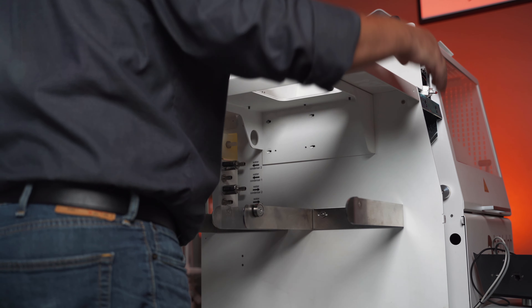The final panel is going to be that top piece. Remember to reinstall your emergency stop — that just clicks into place. Line your pins up here with these two holes, and the post from the locking mechanism. Give a little punch. Attach the two screws at the top. And then lastly, we'll be installing the locking knob. Just make sure that that arrow is in the 12 o'clock position, and then that grub screw should line up nicely. Screw that down into place and you're good to go.